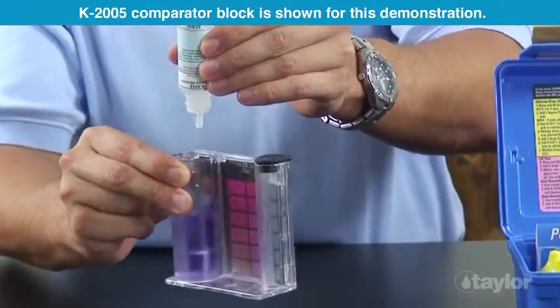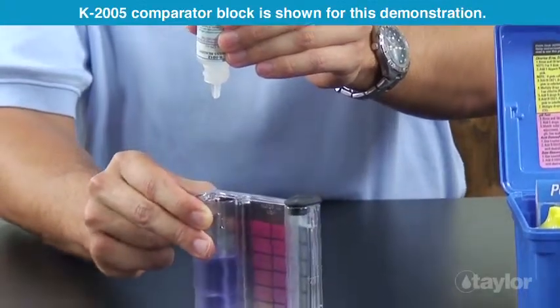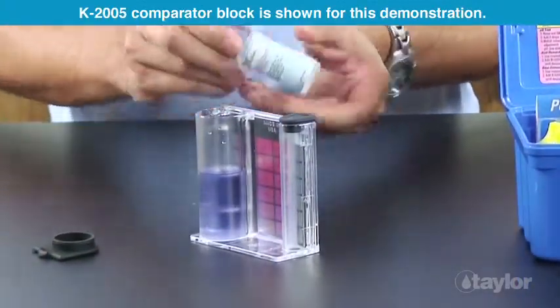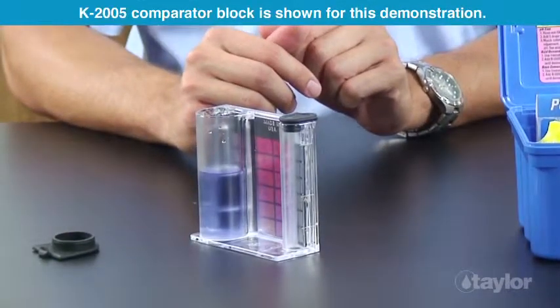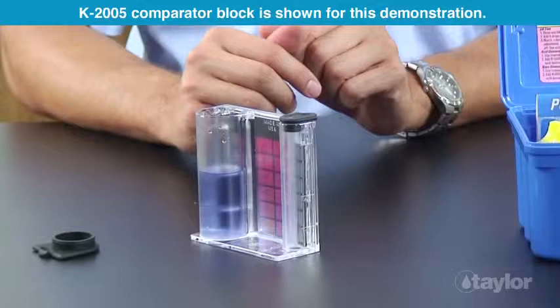If the color remains unchanged, do not count this drop. Multiply the drops by 10. Record as parts per million calcium hardness as calcium carbonate.